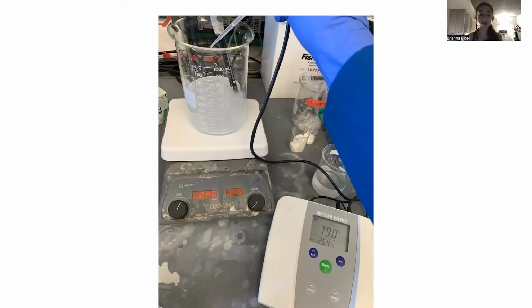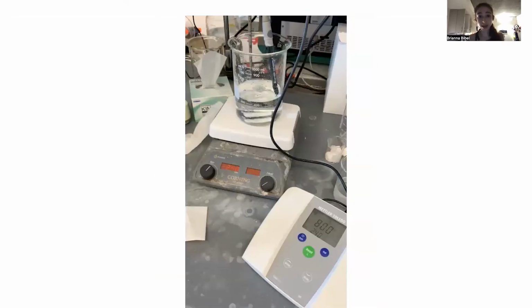And so finally, you want to make sure that it's all dissolved too. You definitely don't want to overshoot it after everything is dissolved. When things are still dissolving, if you overshoot a little bit, not majorly, then you can be like, okay, I know it's going to come back down a little, so it's okay. And you can squirt in a little more without having to worry, squirt a little less carefully in terms of how much you put in. You can squirt larger volumes, knowing that it could still go down. But once it's all dissolved, well, now you're out of luck if you want to go down. So you want to be really careful at the end when you're adjusting the pH.